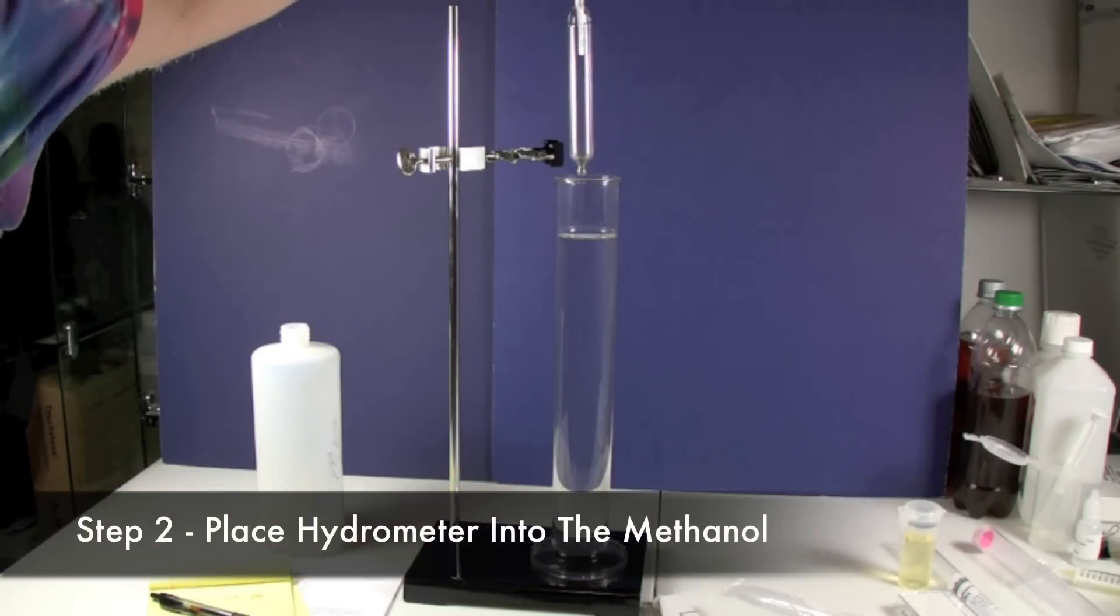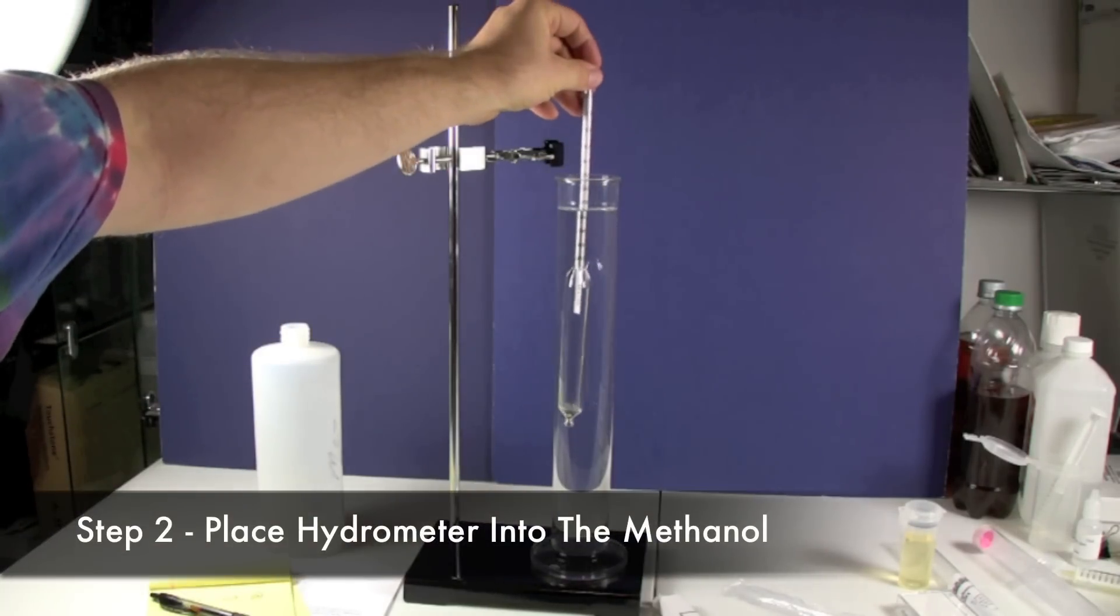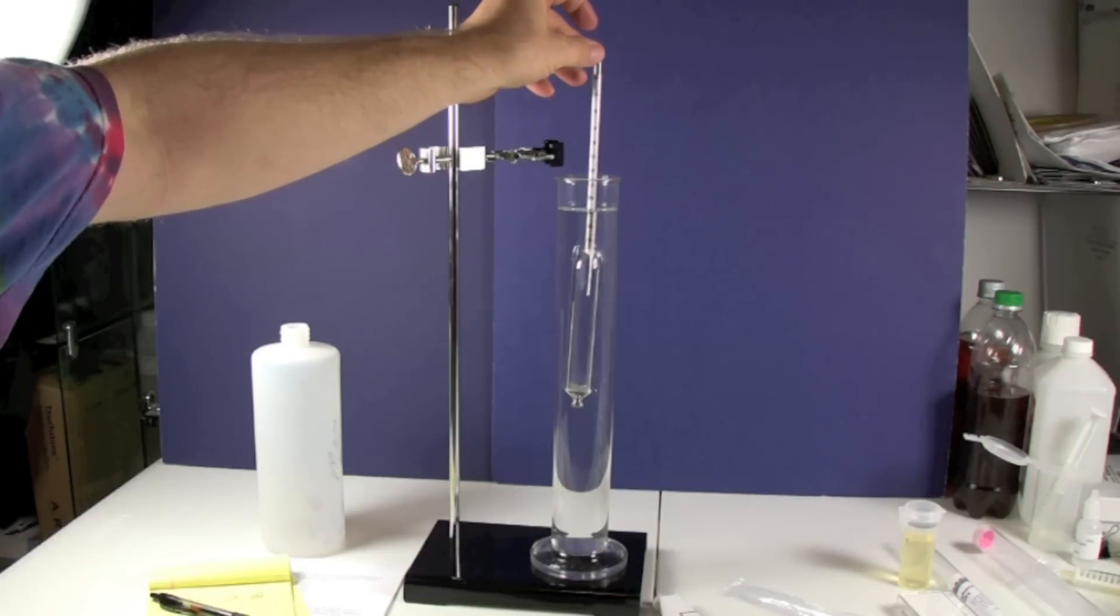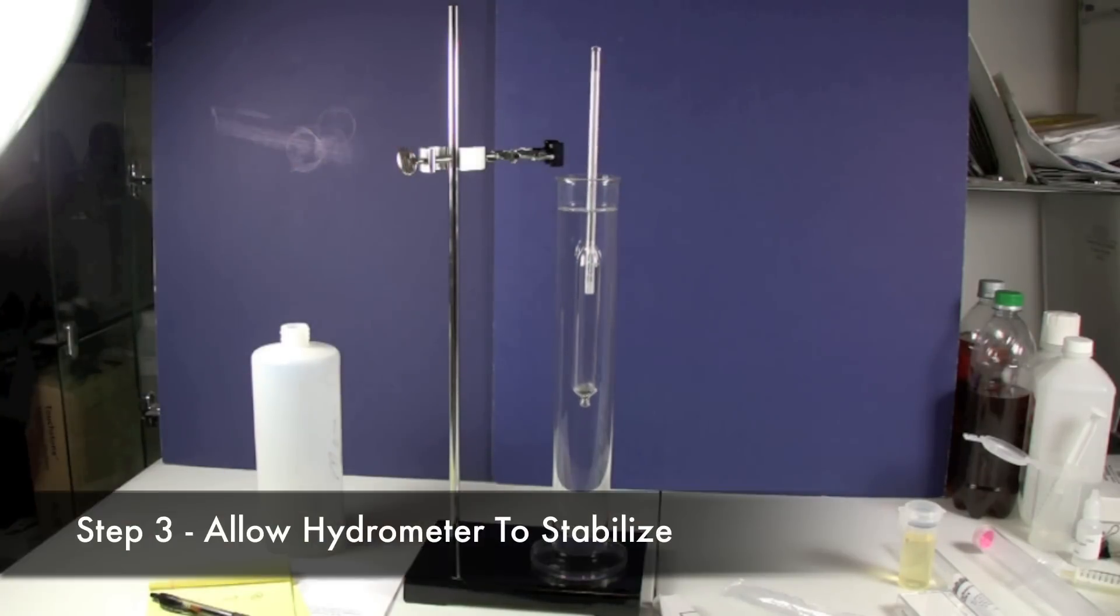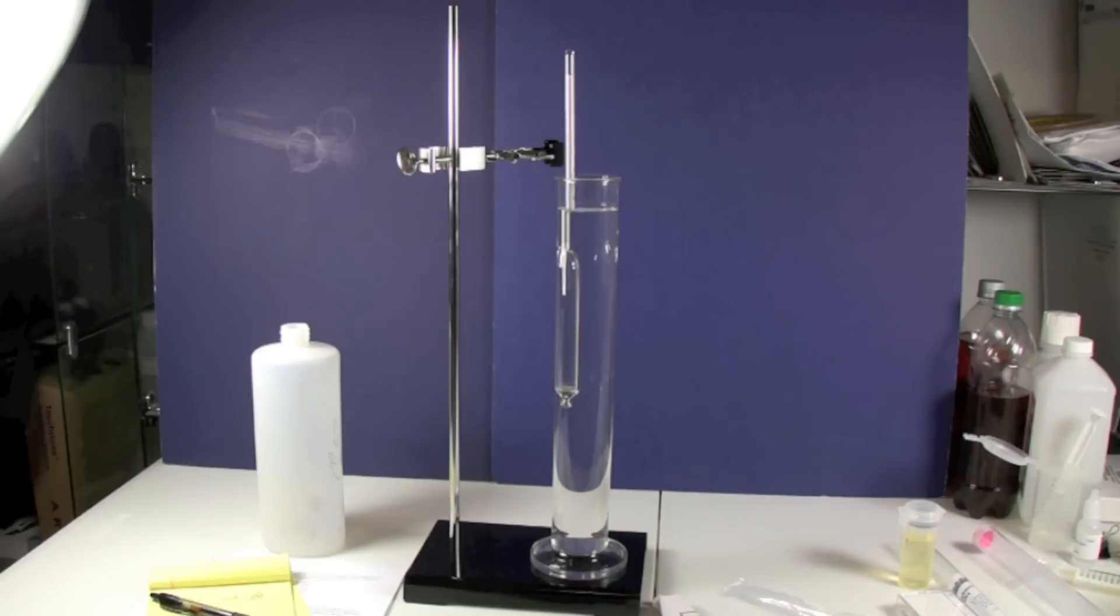And we're going to put the hydrometer in first, and we're going to just let it stabilize. Let it sit in there for a good minute to two minutes and just walk away for a while. Let it really stabilize before you take a reading.